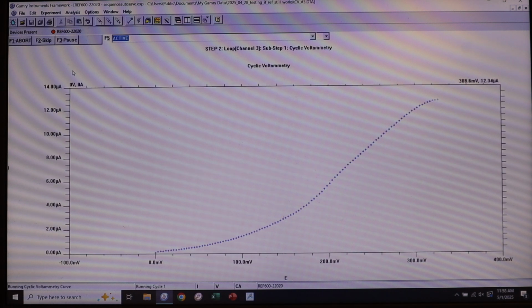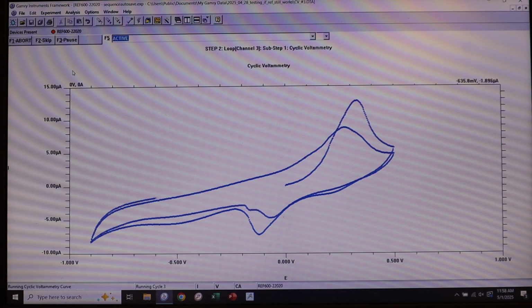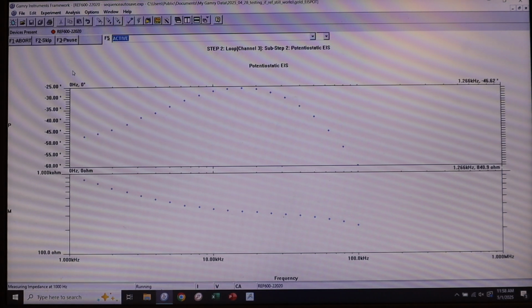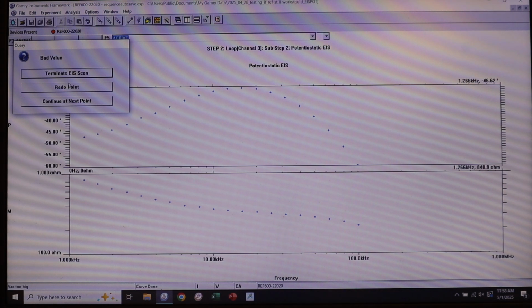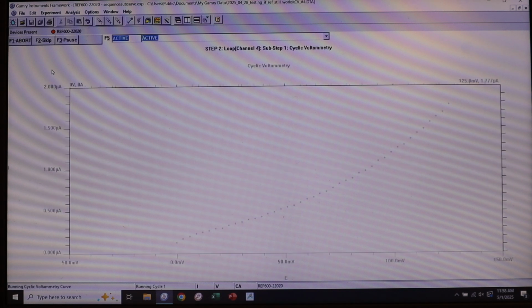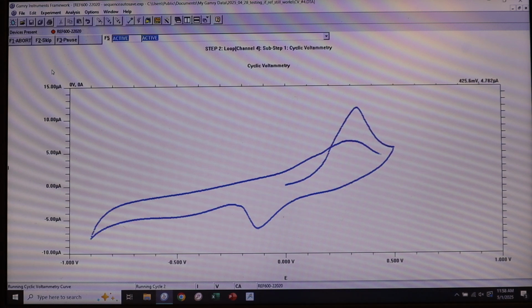And again, we see that our cyclic voltammetry is working just fine. But it seems that we're having problems looking at the impedance spectroscopy for these electrodes, and it doesn't seem apparent that the way that it breaks down is the same either. So we start to get flashing, and then here, just like on channel 2 but not like channel 1, we get the terminate EIS scan saying a bad value warning. So we'll terminate this. We'll look at channel 4 here. Again, CV is working fine, and we just don't know exactly what's wrong with our impedance spectroscopy.